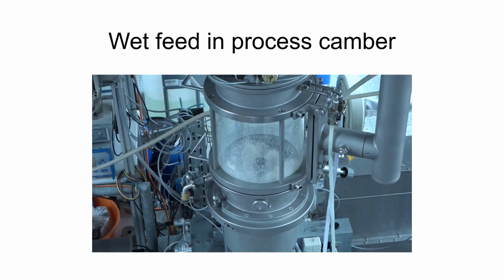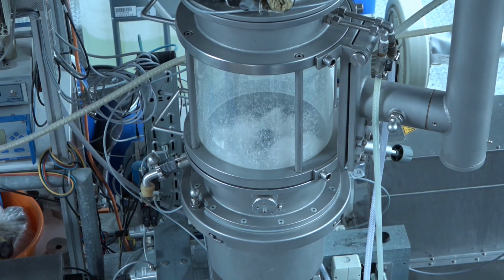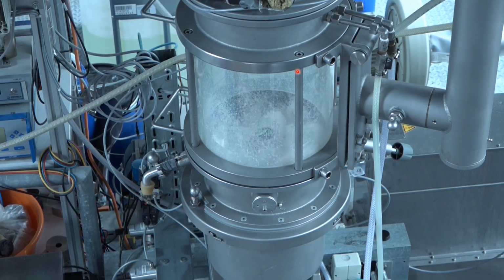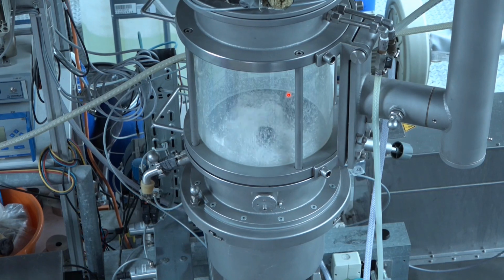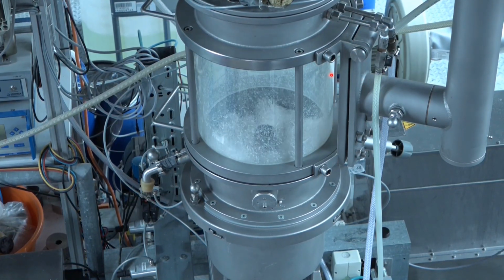And now I would like to show how it looks when this kind of wet material enters the fluidized bed process. So please observe a little bit here. It will come from here and then get into the fluidized bed process.